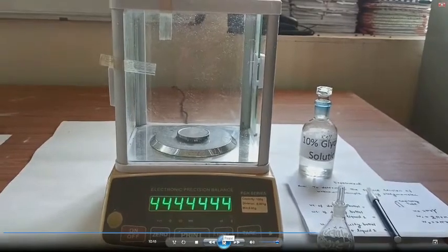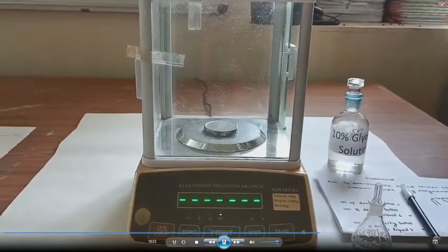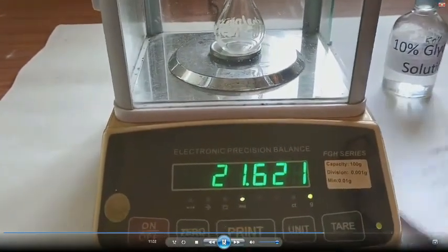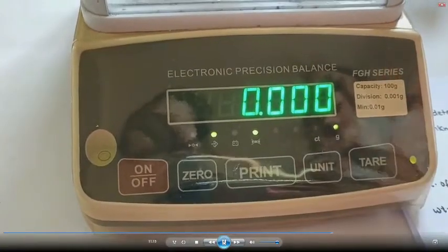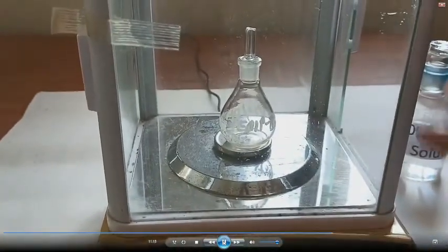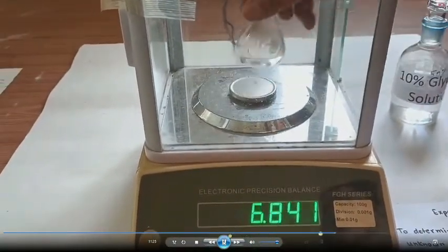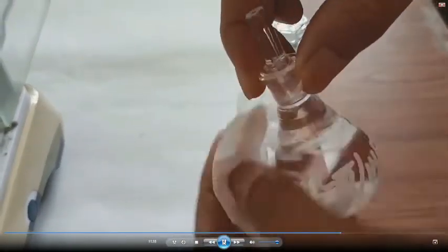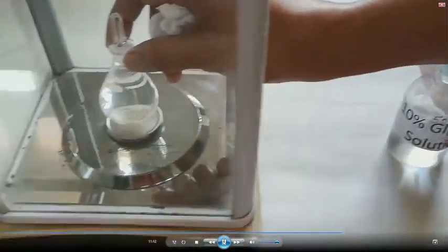To determine density using the density bottle, first we initialize the electronic balance and weigh the empty, perfectly dried density bottle. We can note this weight or use the tare function so it reads zero. In the next measurement, I first fill the density bottle with 10% glycerine solution, thoroughly dry it from the outside, and then weigh it.